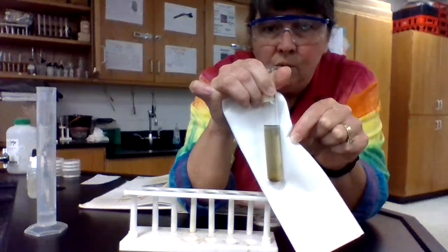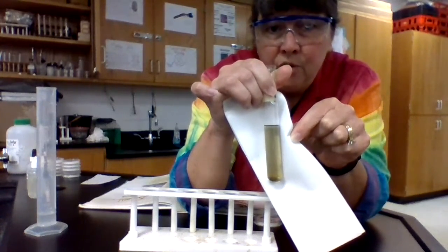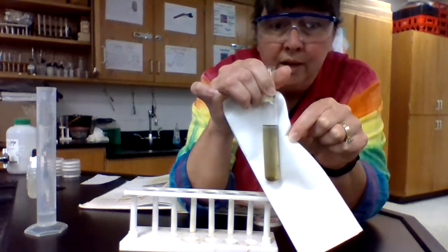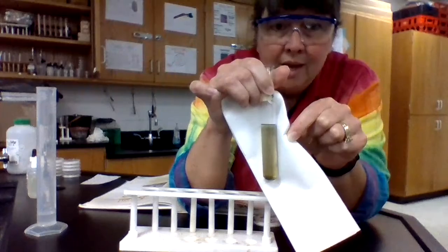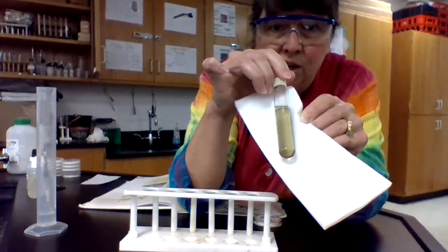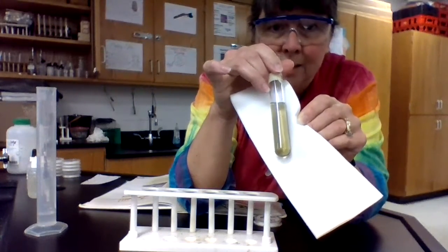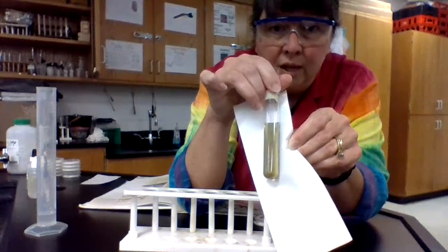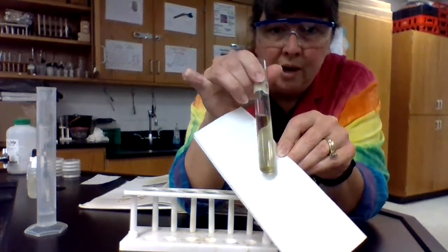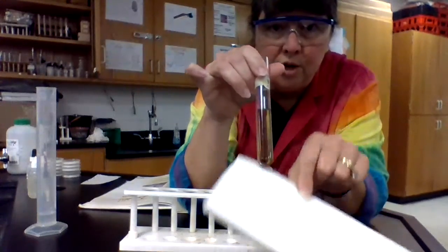So by whatever results we've gotten, your microscope view, and then the second test was the solubility. It was not soluble. And then the third test was the iodine test, and it is turning this dark color. They call it this blue-black color, and that's what it's looking like. If it sits longer, it gets darker. But that is going to be the last test that you have to do for unknown number 1.